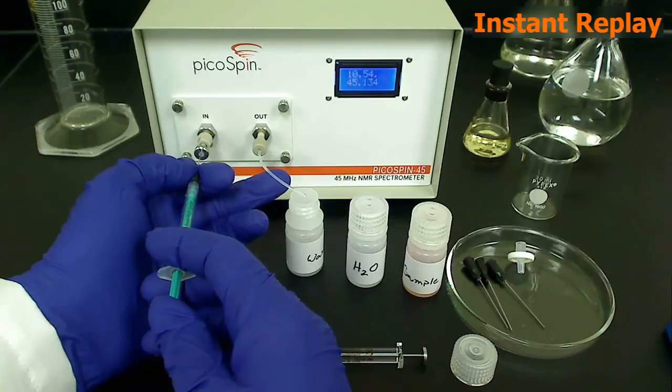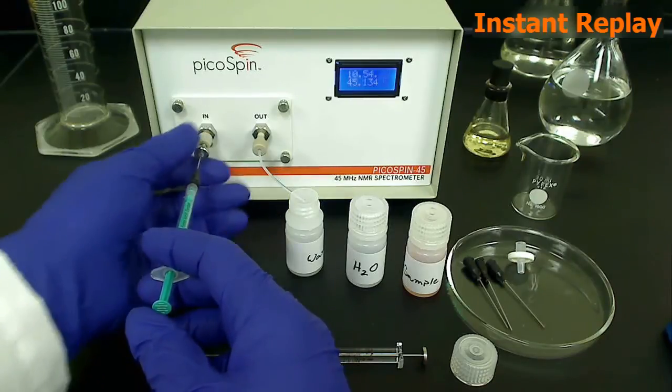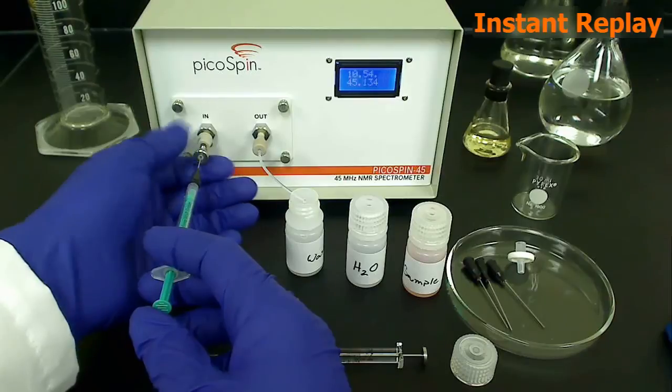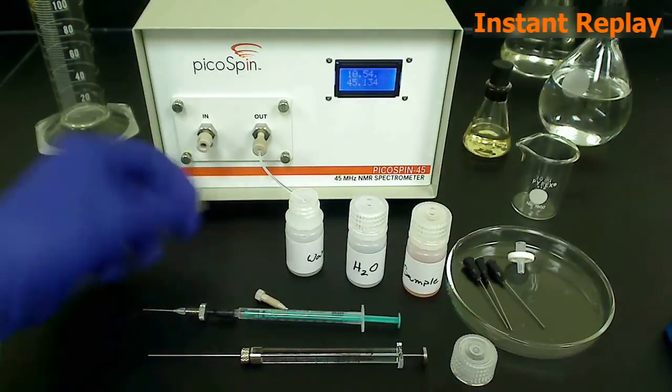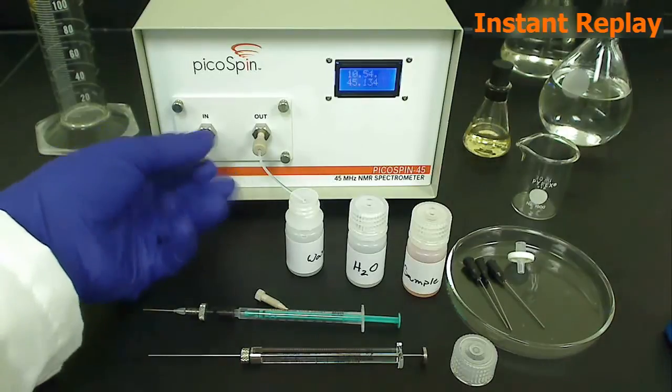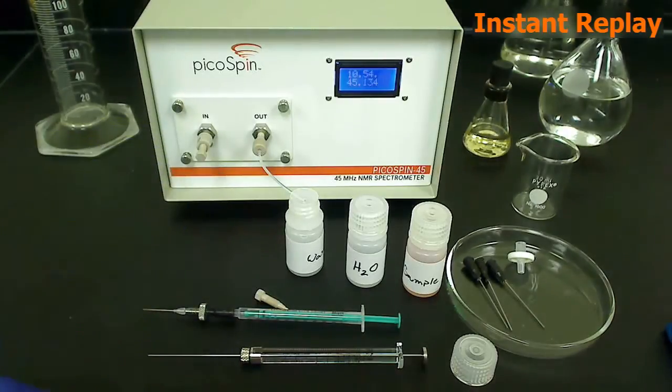I'll follow this up by capping the inlet fitting to minimize thermal motion and reduce sample loss due to evaporation, and then conduct the experiment. Often, I leave the drain tube in place, but if my solvent or sample is volatile, or if I'm performing a long experiment, then I'll cap the outlet fitting as well.